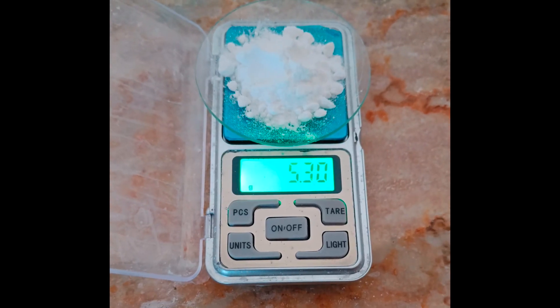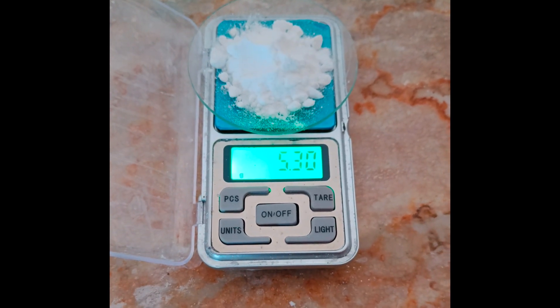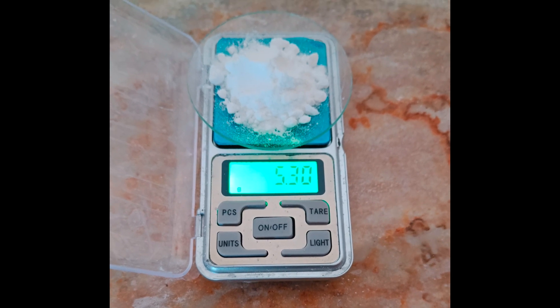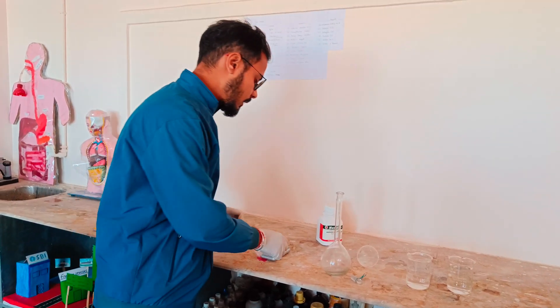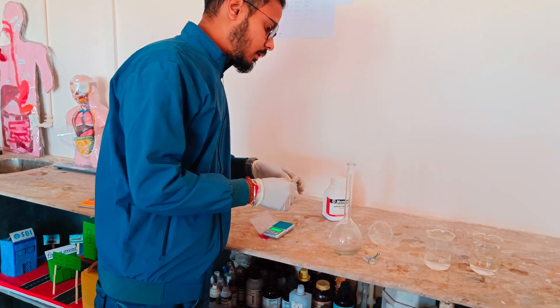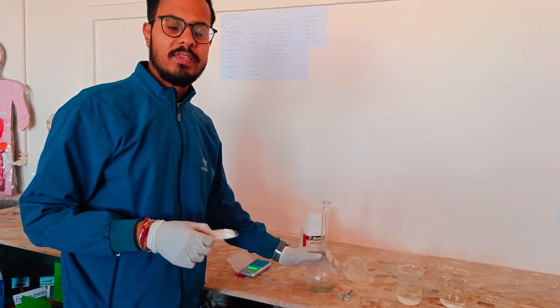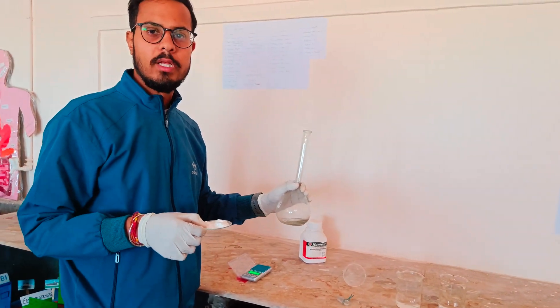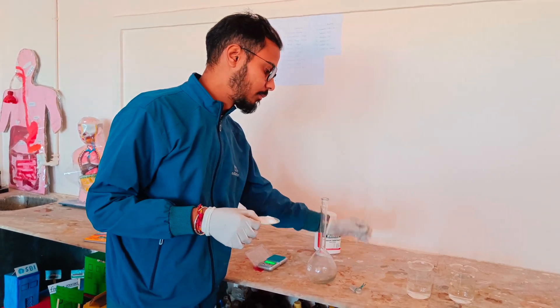Here we have taken exactly 5.3 grams of sodium carbonate crystals. Now we will fill the measuring flask with these sodium carbonate crystals with the help of the funnel.